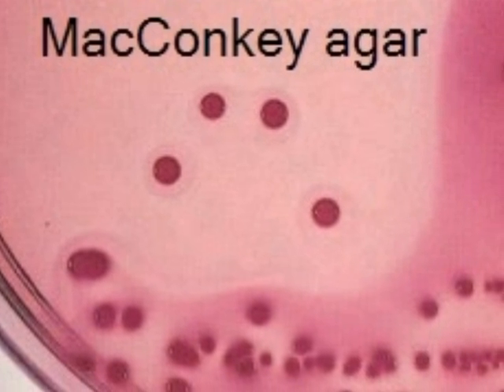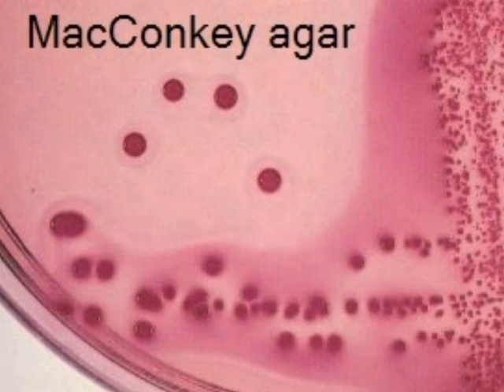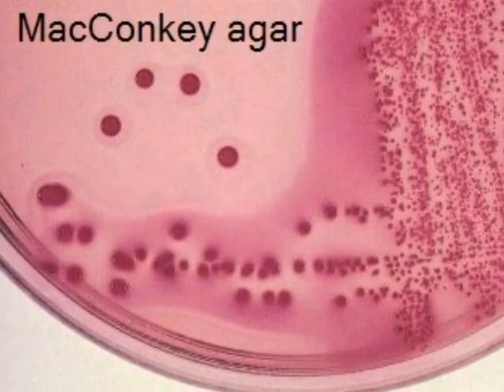Note the bile salt precipitates in the media surrounding the colonies as well. Your interpretation should be, the microbe tolerates the crystal violet and bile salts, it ferments lactose, and is most likely a coliform.